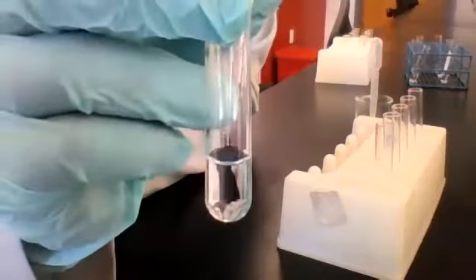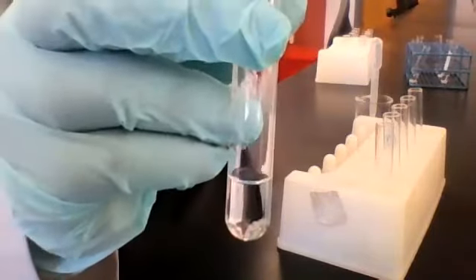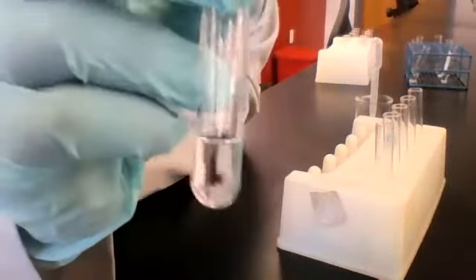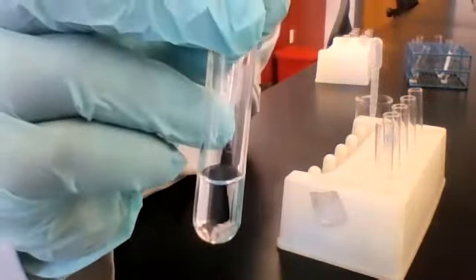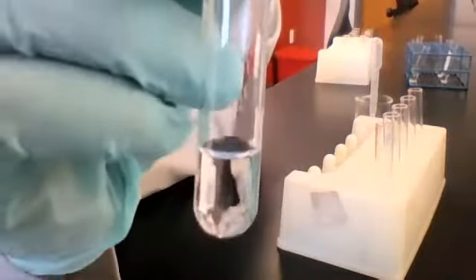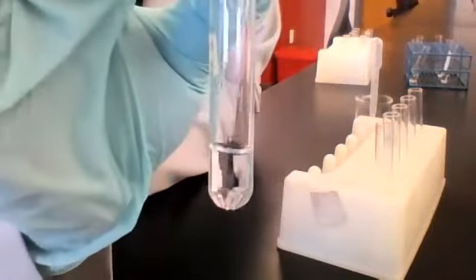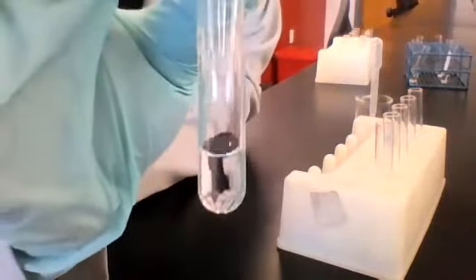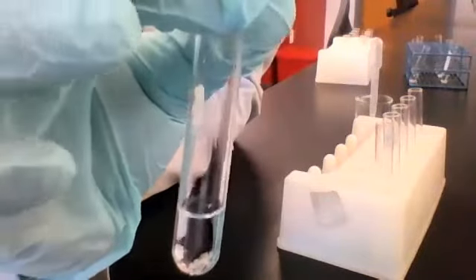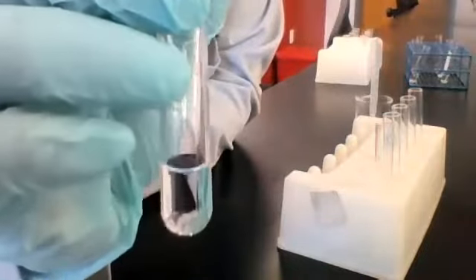So we're not expecting any change. If it was soluble before, it would be soluble after. So if it was a clear colorless solution before, it'll be a clear colorless solution after. And that's what we're seeing, okay? You guys are doing so great. All of our predictions have been correct so far, and I hope everything's making sense. If you have any questions, please let me know and I'll answer them, okay?